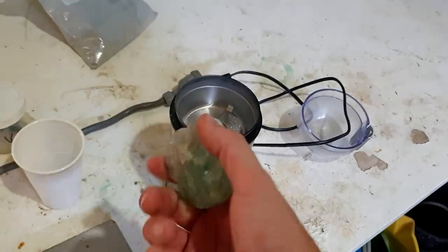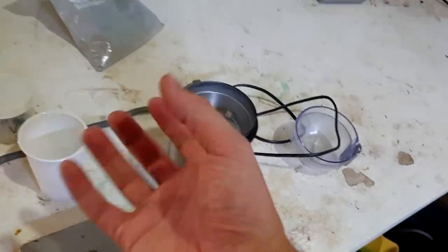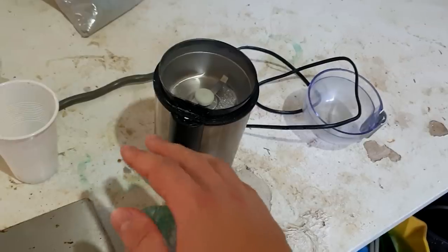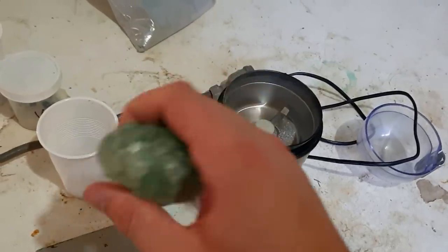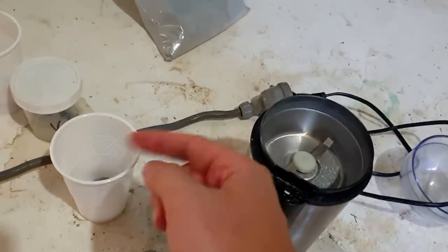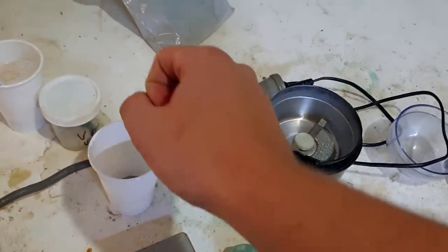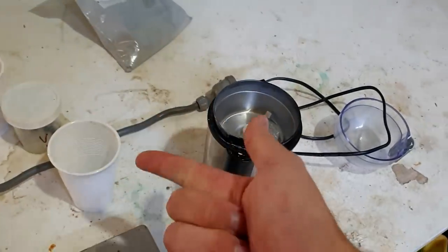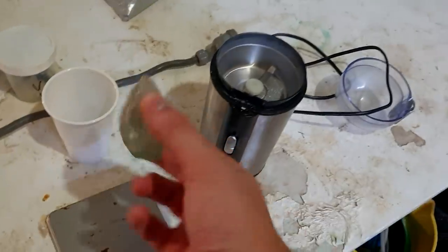Second, hopefully the fluoride will form a eutectic with the alumina that's going to form — the aluminium oxide — and that will hopefully be more liquid at a lower temperature and stay molten for longer. The third thing it does is potentially have the fluoride anion react with the surface coating of the aluminium when it's hot, making the aluminium slightly more reactive so it will begin to melt at a slightly lower temperature — melt easier, be molten for longer and thinner.